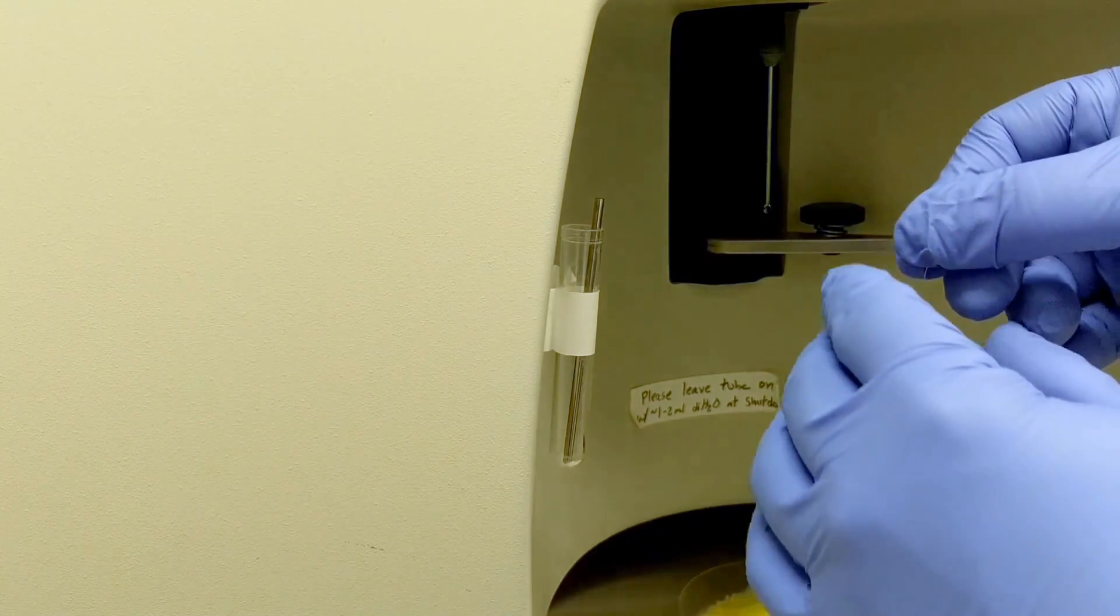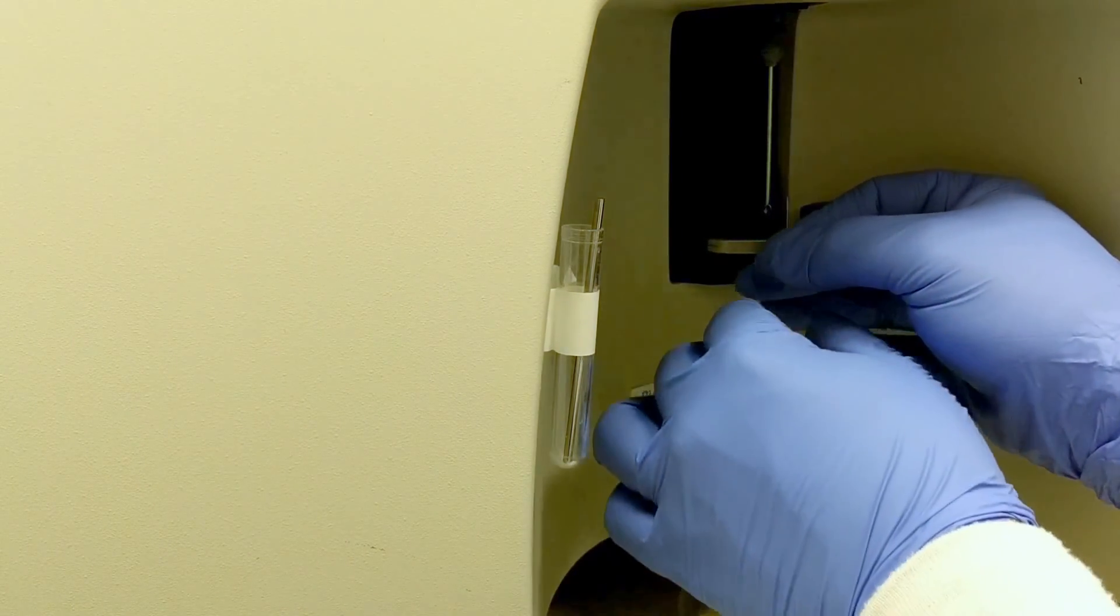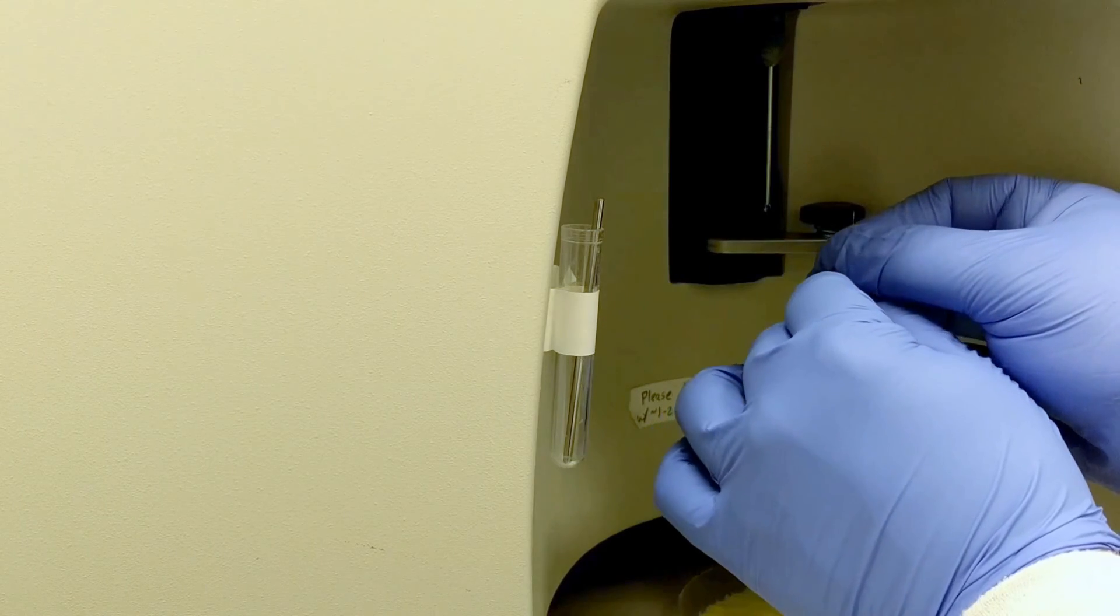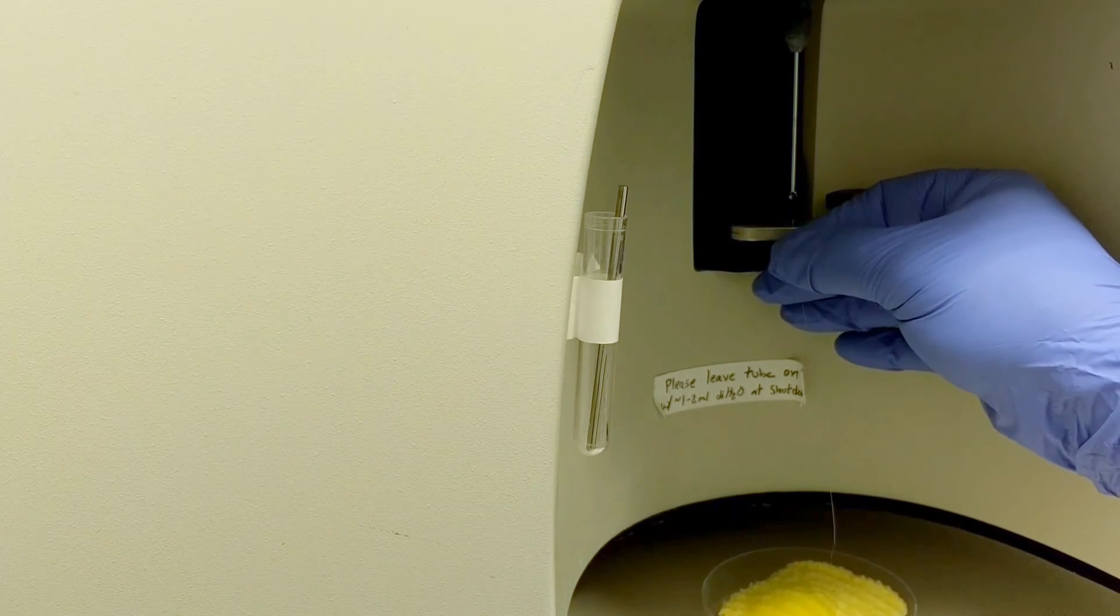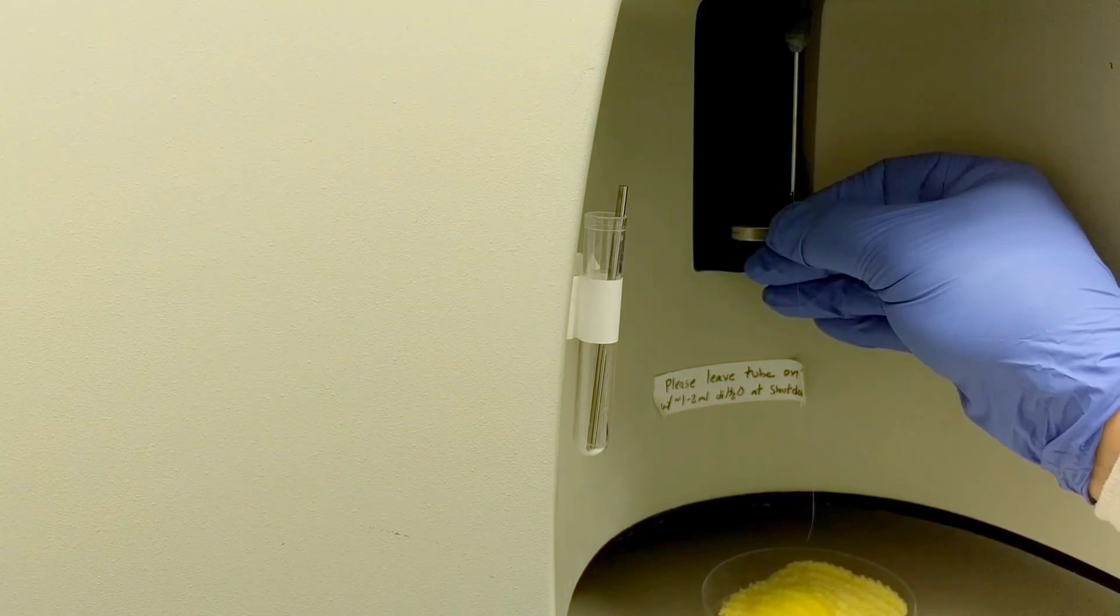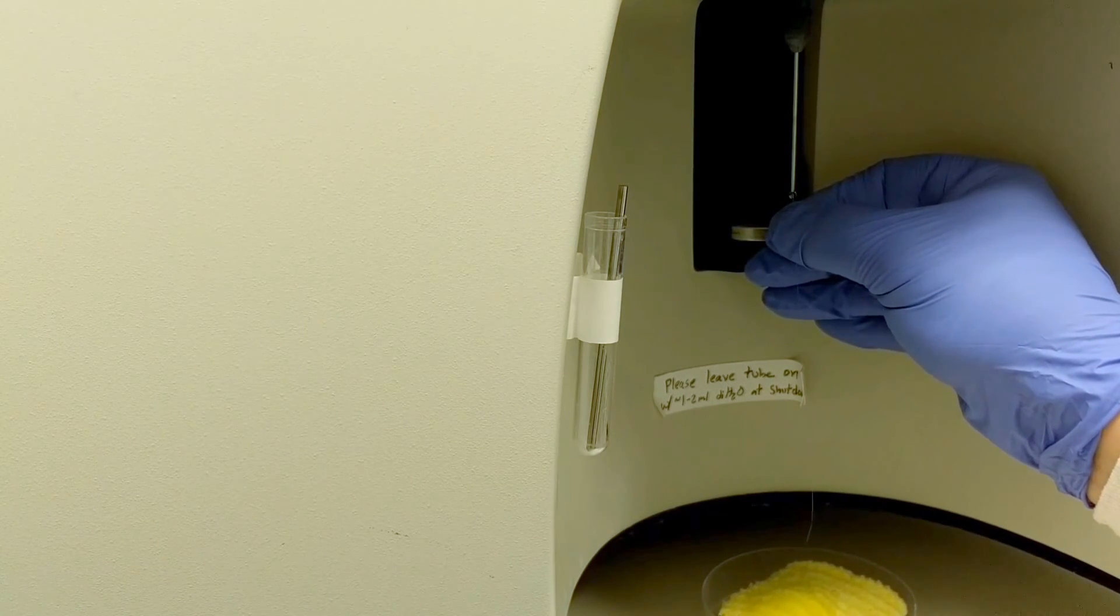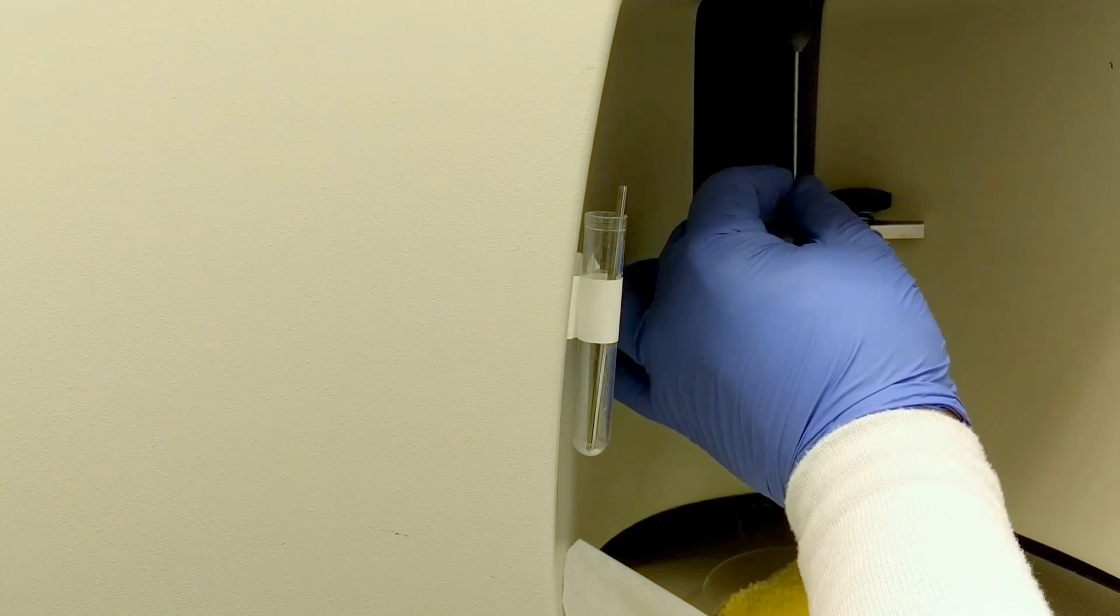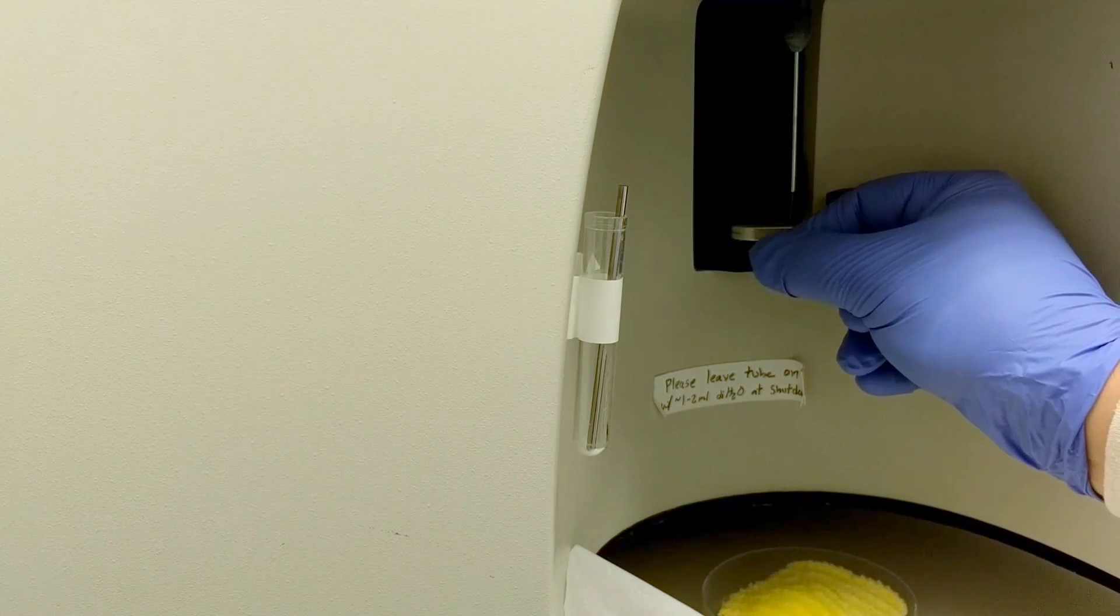And so you're going to take your straight end. And you're going to do your best. You can do this on standby so it's not dripping. Change it to standby. And you're going to do your best to thread the wire into the sip. This can be an extremely difficult process. Often, it takes several minutes before you get it to thread.